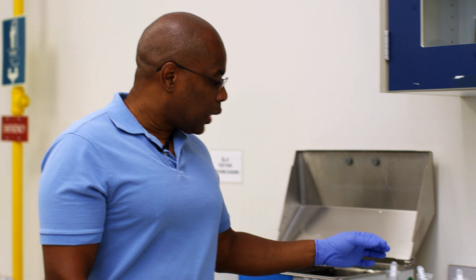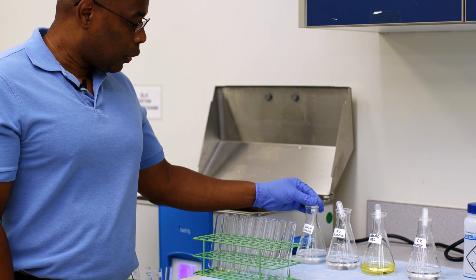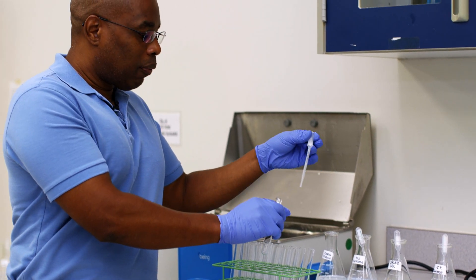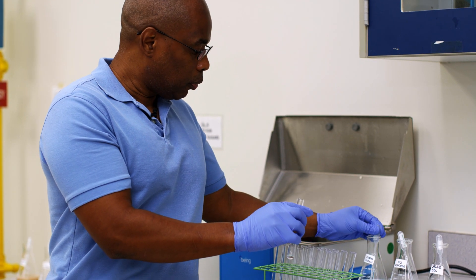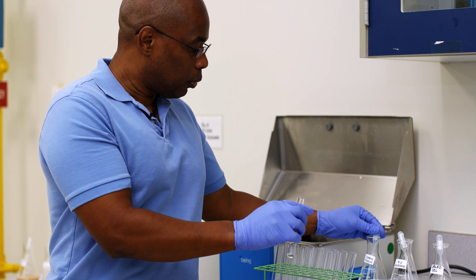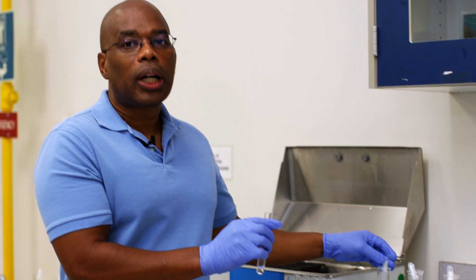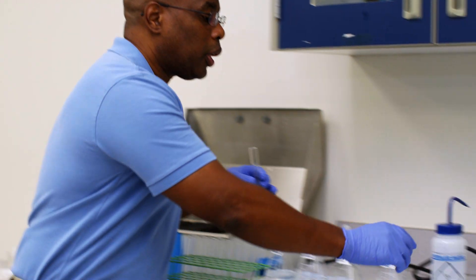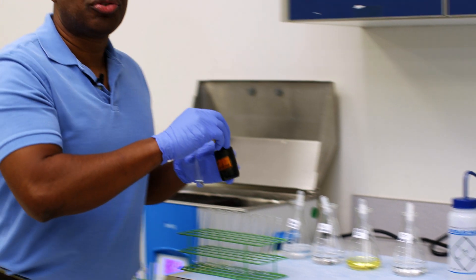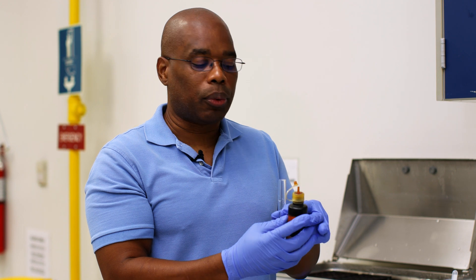So let's look at one of our samples. I'm going to take two mils of cornstarch, and as before, I'm going to put the two mils in a test tube. Then we're going to add our Lugol's solution. For this particular solution, we only need two drops in order to see if we're going to get a reaction.